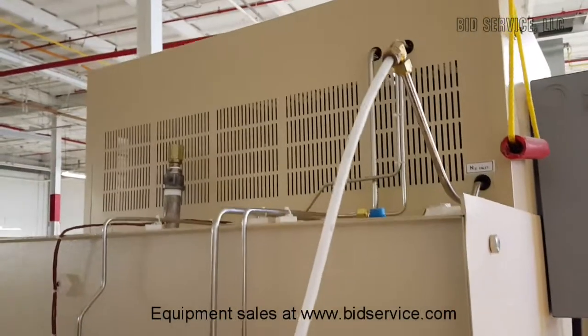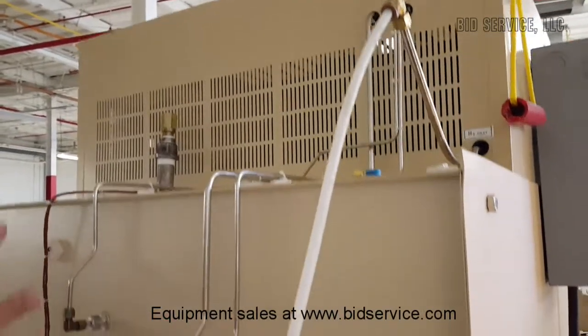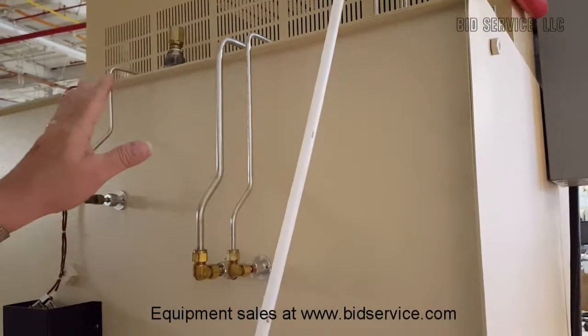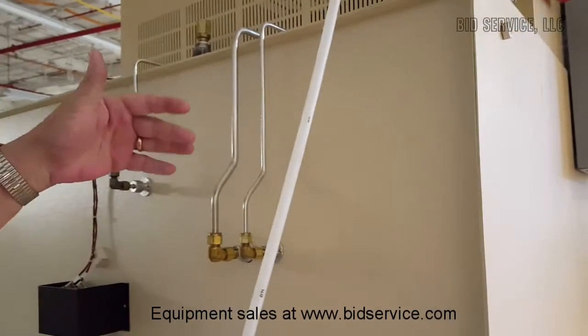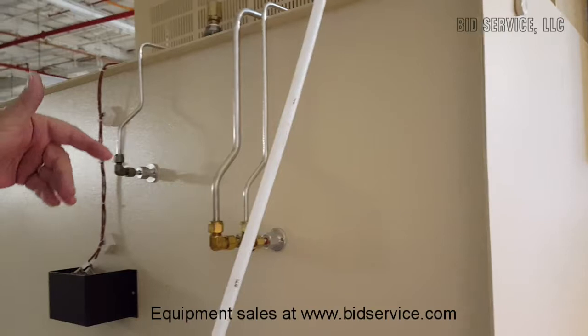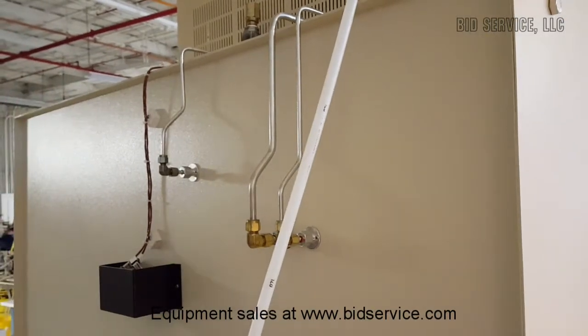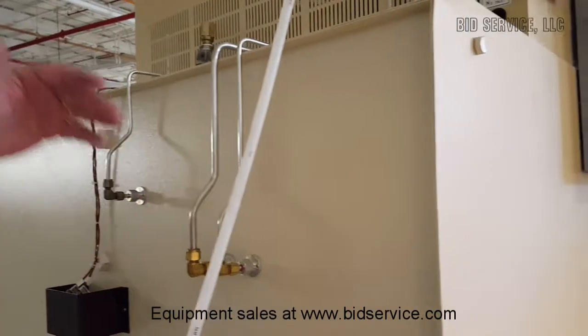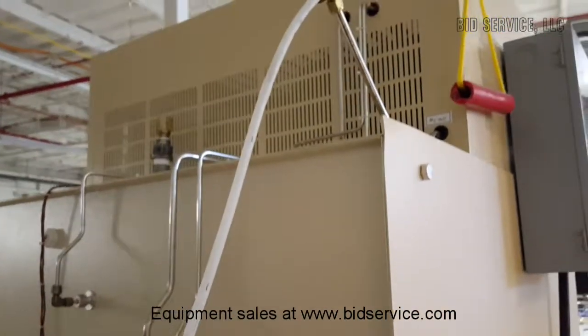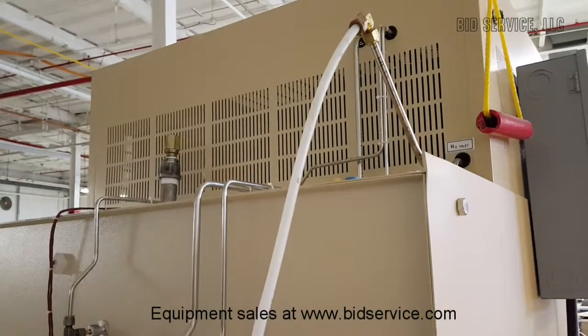In the back here, these are your differential air controls. This is what determines your airflow, which in turn is governed by the speed of your fan — which has to do with the phasing I talked about earlier. If the fan is not efficient, it's not going to give you enough airflow, and you know that the phases are out.